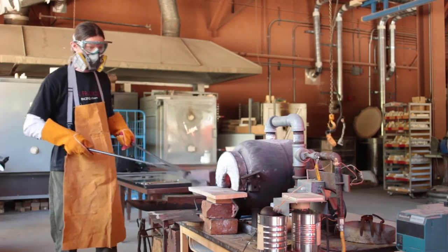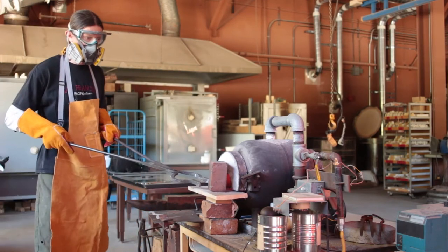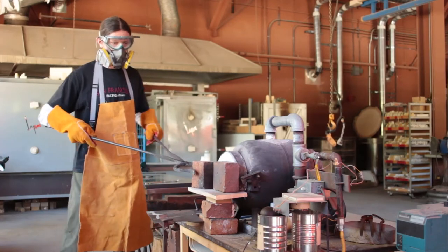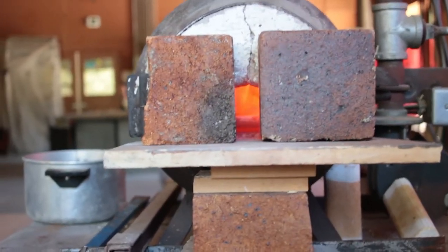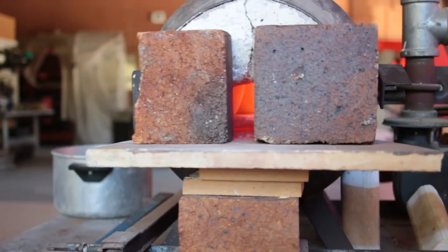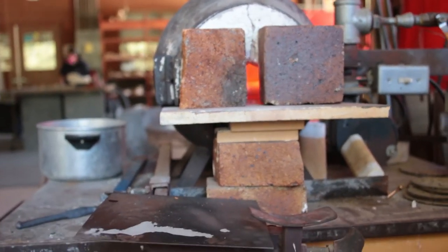It was necessary to close off the front of the furnace to maintain temperature and a reducing atmosphere. This first step is to heat the crucible to 750°C for four hours under a reducing atmosphere. During this phase, the sulfur is being reduced to sulfide and polysulfides while the silica and alumina bond to form the sodalite cage structure around those sulfide ions.